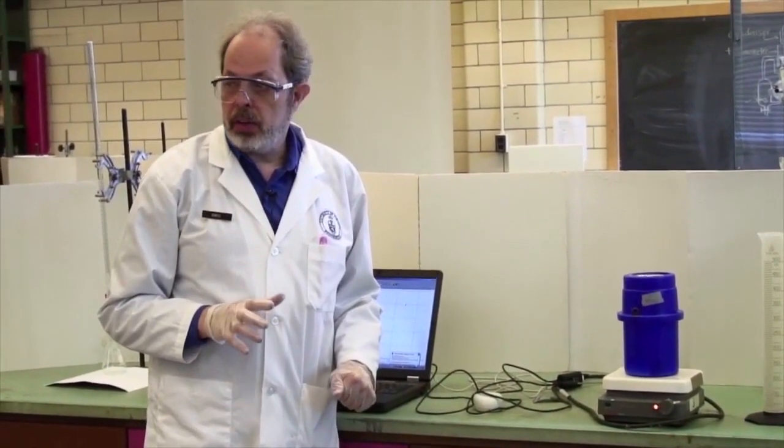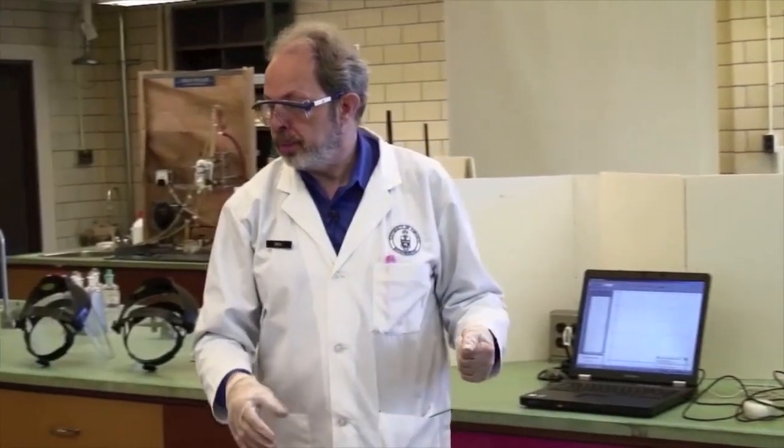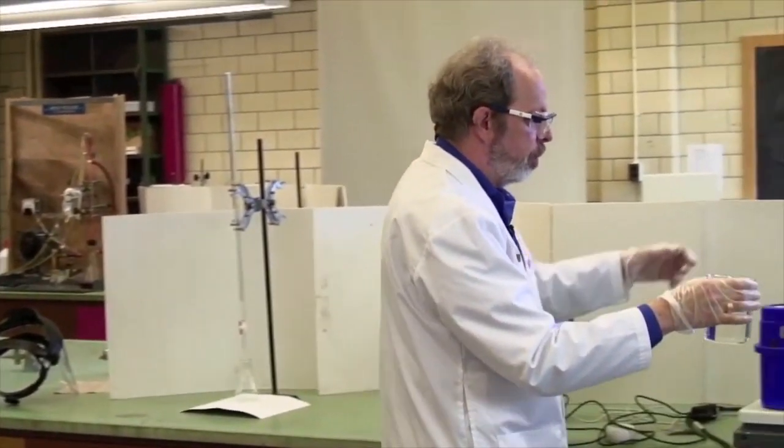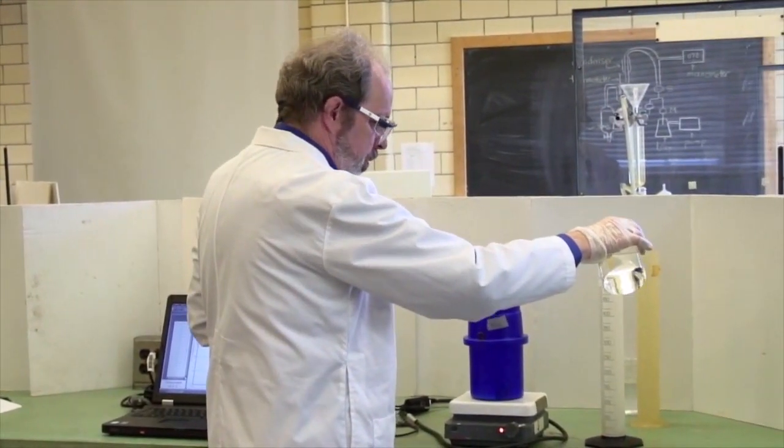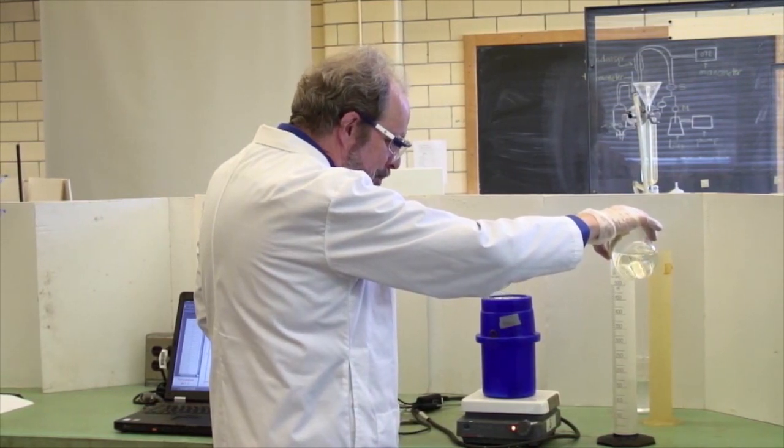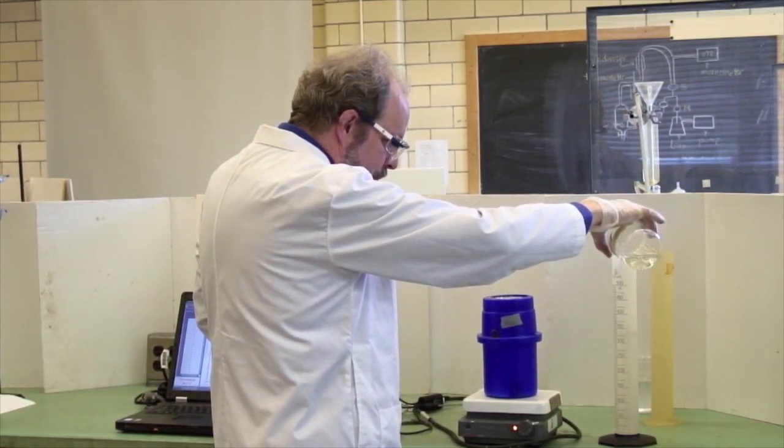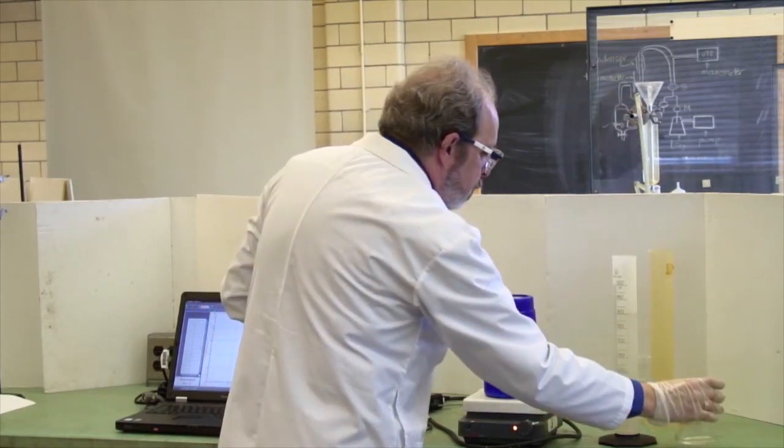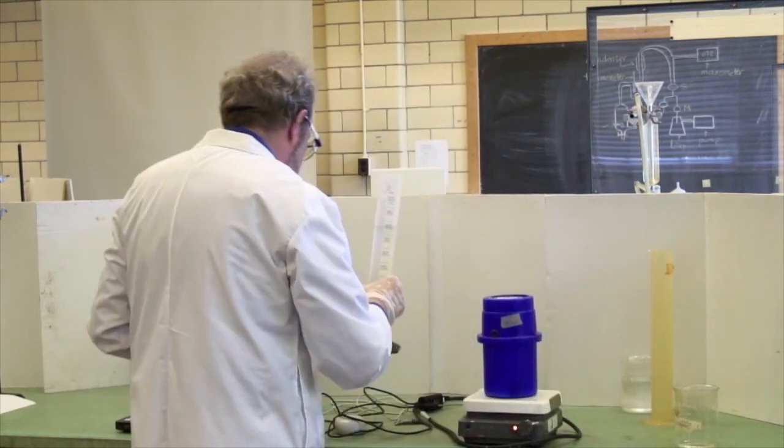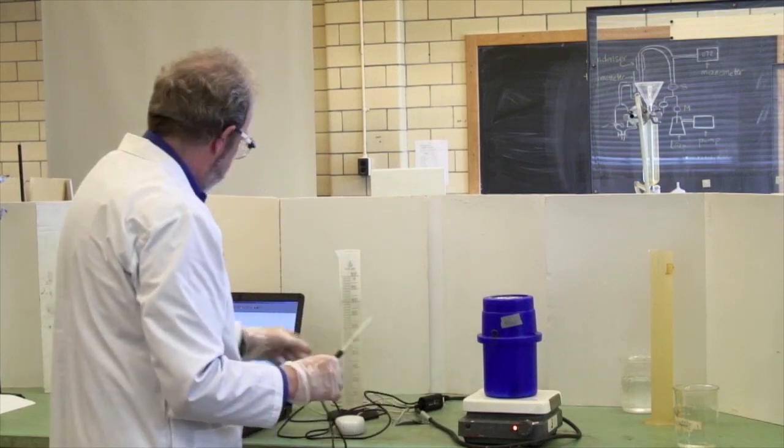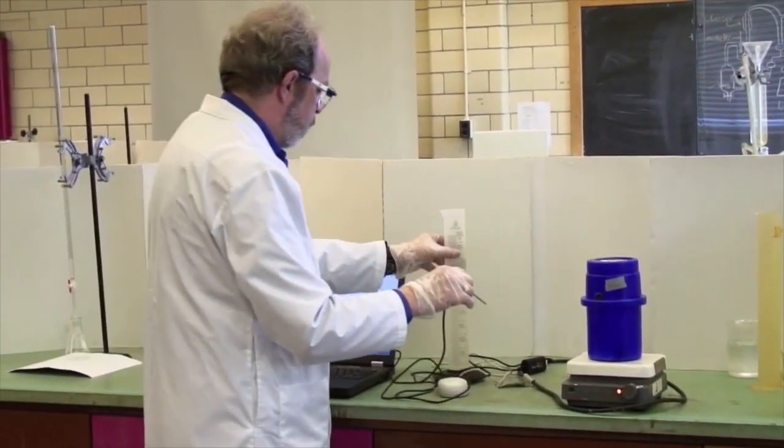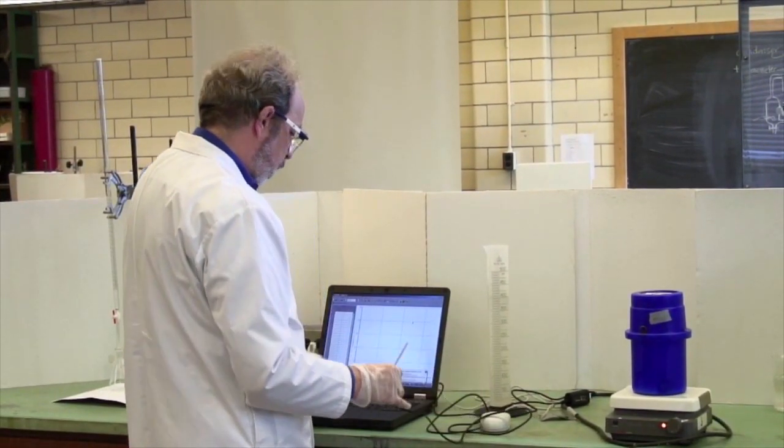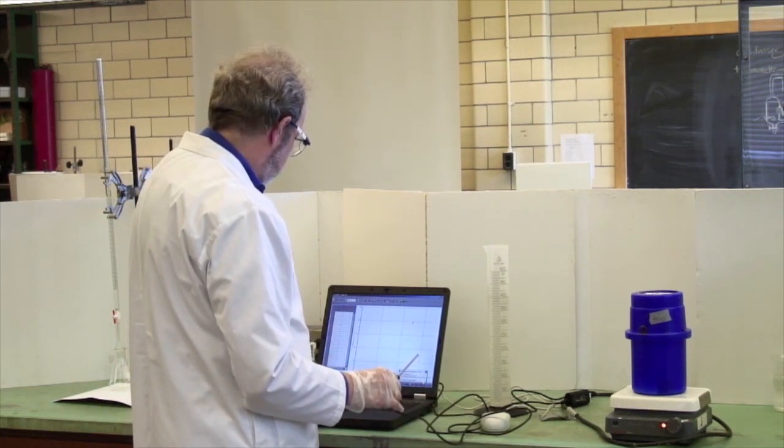We have hot plates around and you should heat up some water to a reasonably high temperature. It doesn't need to be boiling hot, temperature of a decent cup of coffee is good enough. So I've heated this, measure out 400 mils of hot water. To start off I need to know how warm this is and then I will measure how cold that is and then I will pour them in together.